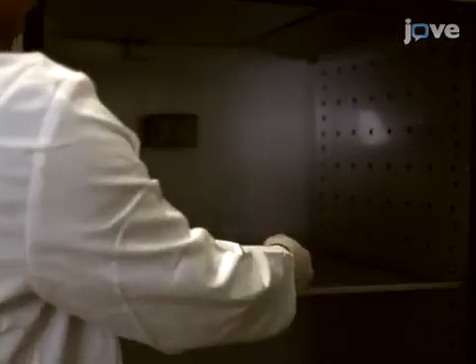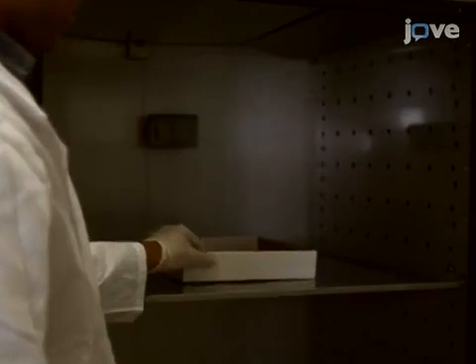Place the flies in an incubator for at least 21 hours under a 12-hour light-dark cycle.